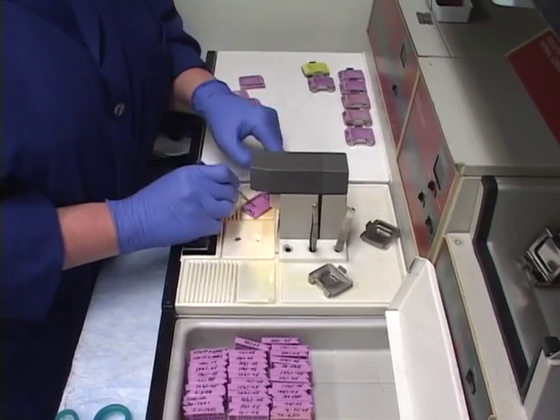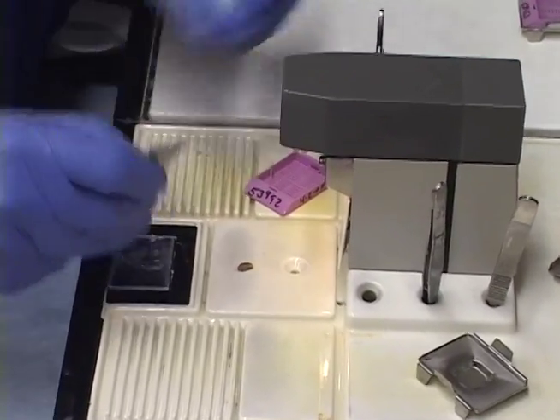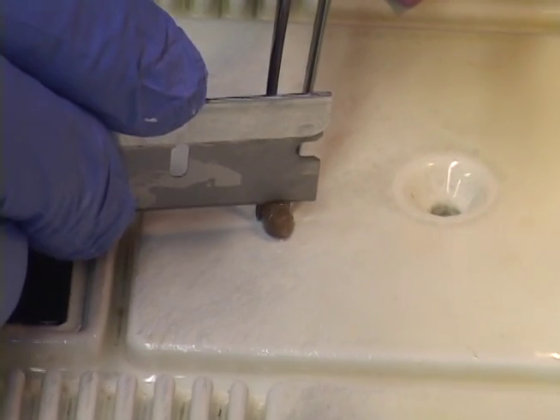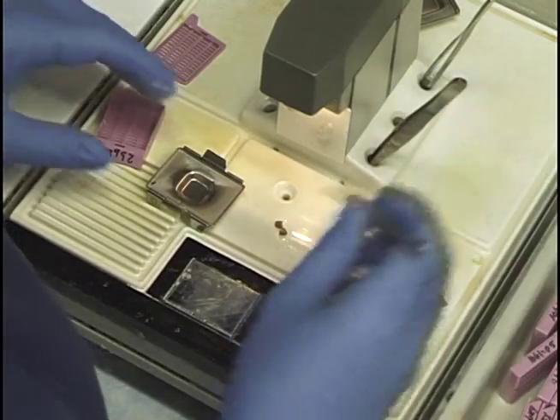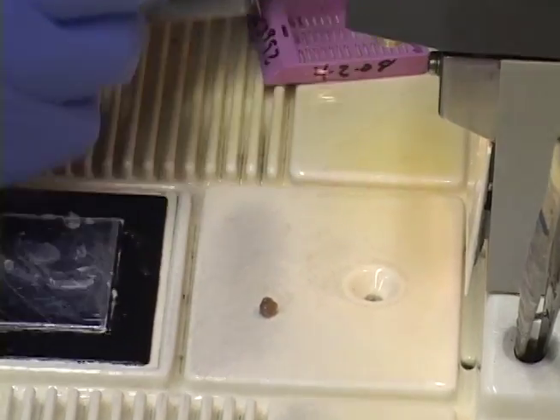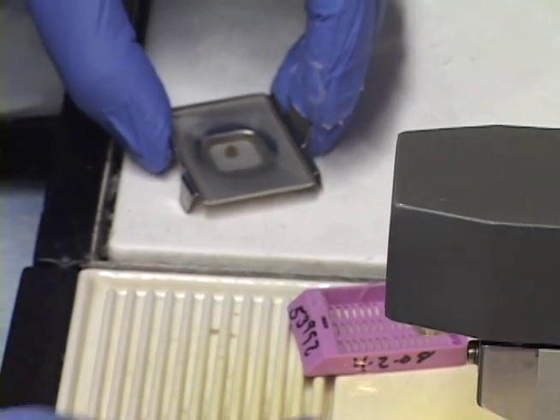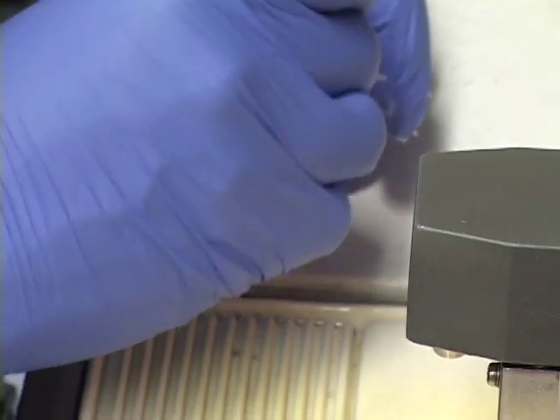We have this kidney. I'll cut it in half evenly — holding it with a forcep and giving a nice clean cut. Don't push; if it doesn't give a clean cut, get a fresh blade or you'll wreck the tissue. I'll embed this one first, purposefully making it unevenly embedded so you can see what that type of block looks like.